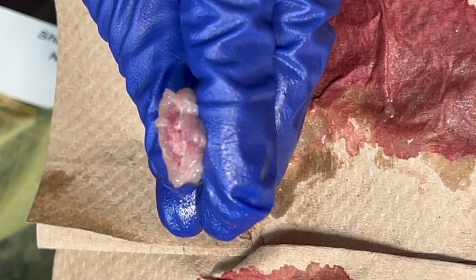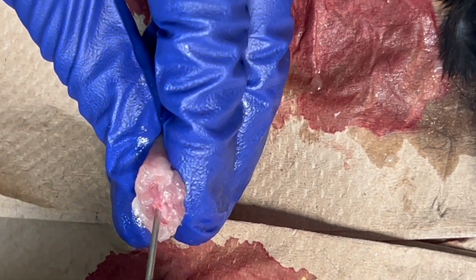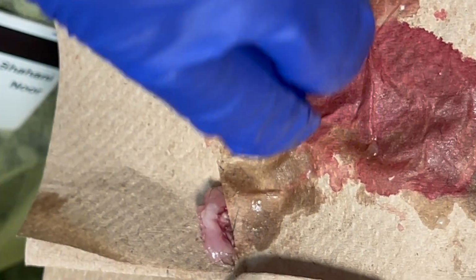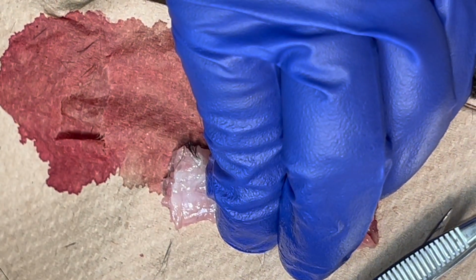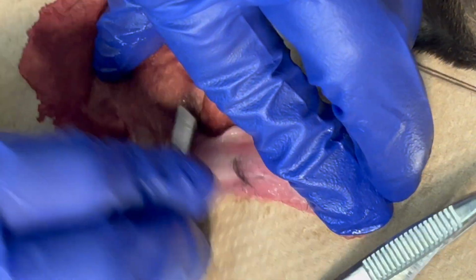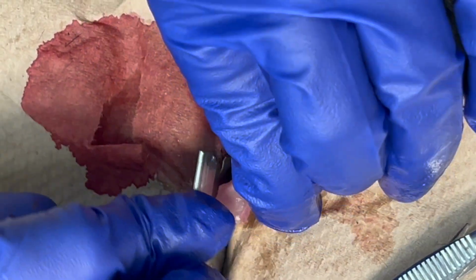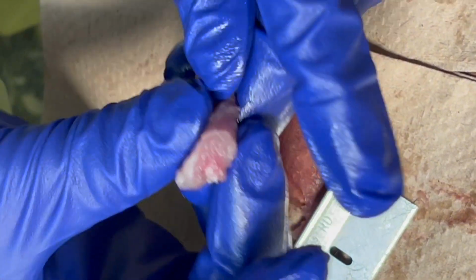And you have to feel a little bit with the spinal cord as well. But one good thing is it's a different color. This is totally for teaching purposes, so we can cut a little bit far, which is almost the lumbar enlargement. But I'm going to cut, just to make you a little more convinced, this is where. Over time you will get used to that tiny little dot, like, nope, that's spinal cord. So do you now see? That's very clear, right? Even if I push from here, I might be lucky and still see the whole lumbar part.